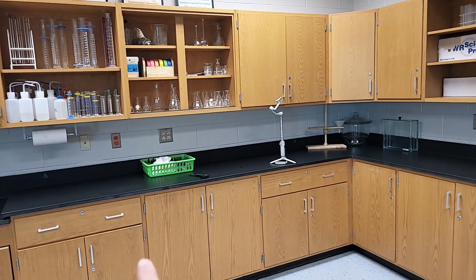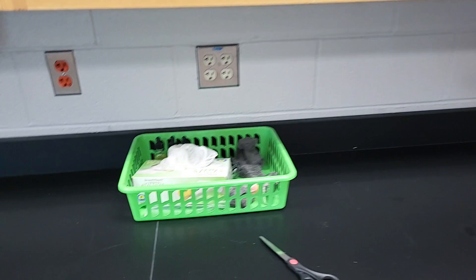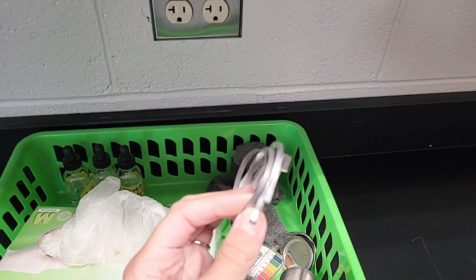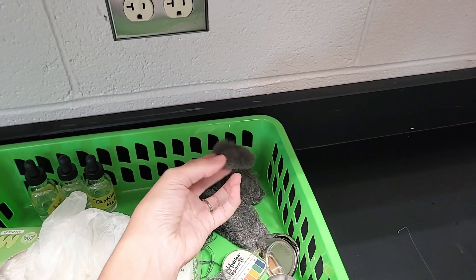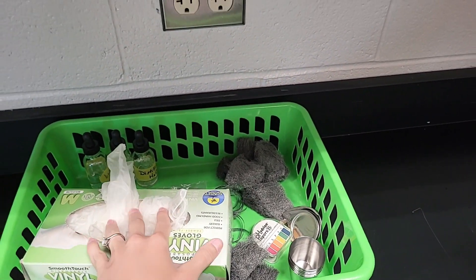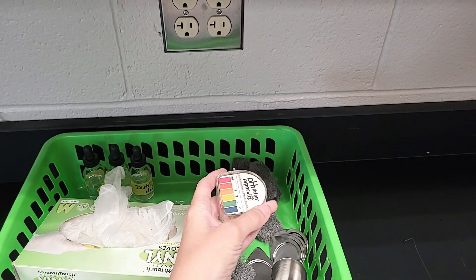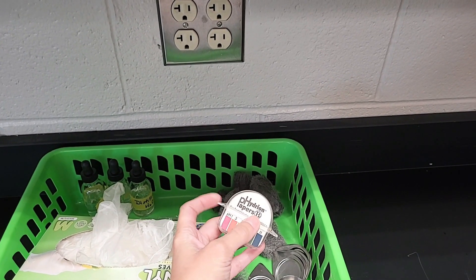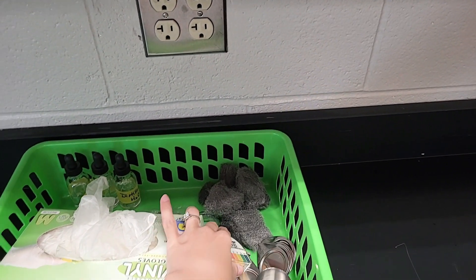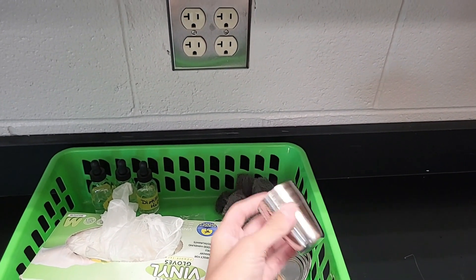I have honors in between AP, so I have to get all my equipment ready in here. I do have some magnesium ribbon but it's pretty oxidized, so I was going to have the students use some steel wool and gloves to clean it. Then they are going to produce ammonia when they add some water to the magnesium product.